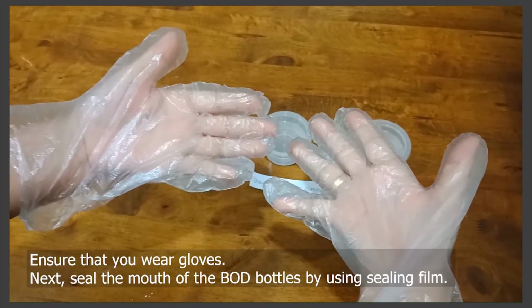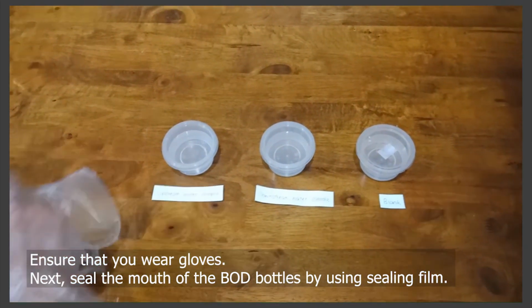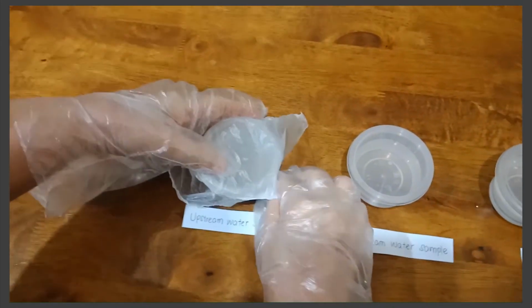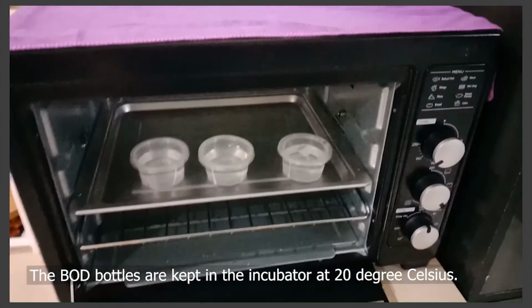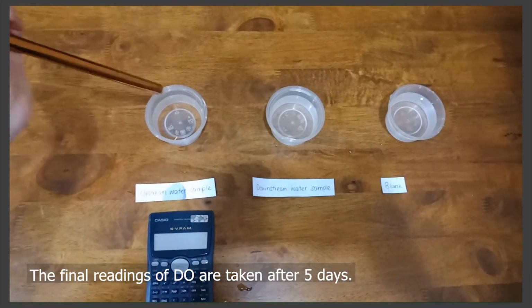Ensure that you wear gloves. Next, seal the mouth of the BOD bottles using sealing film. The BOD bottles are kept in the incubator at 20 degrees Celsius. The final readings of DO are taken after 5 days.